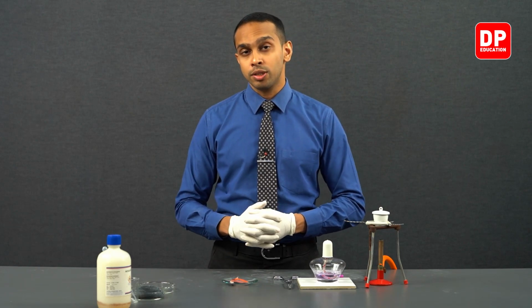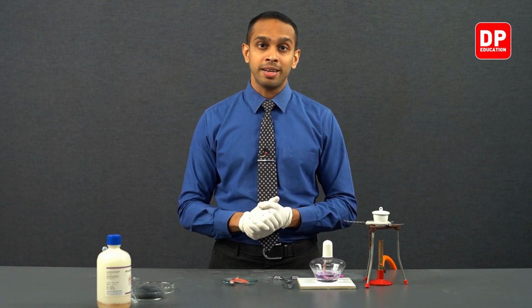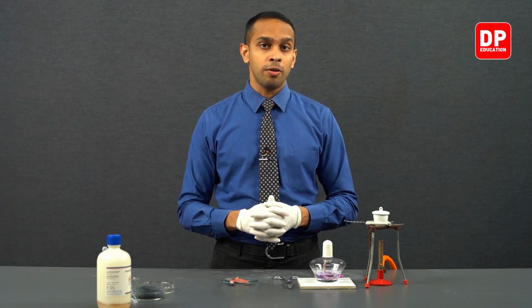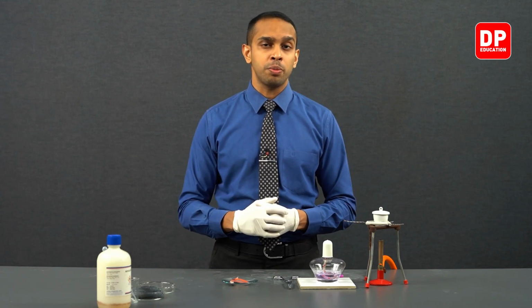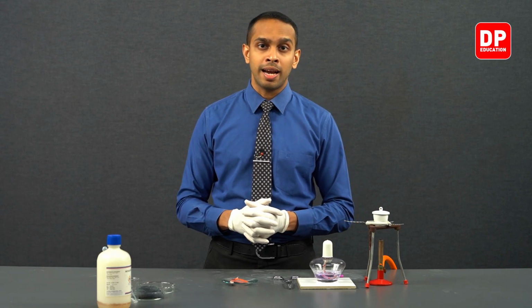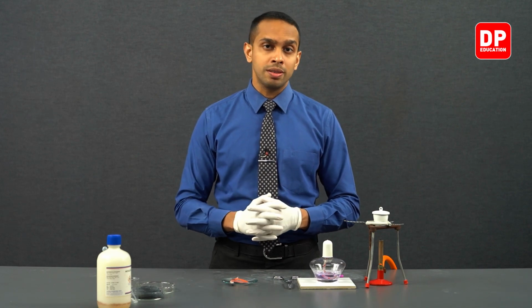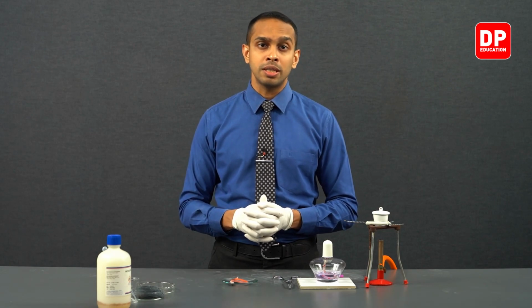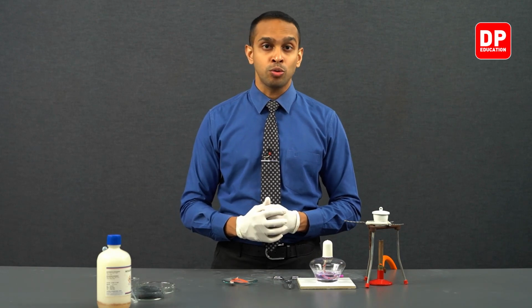Now students, as I mentioned earlier, we are trying to show that the atmospheric air contains nitrogen. Around 78% of the atmospheric air is actually nitrogen. Around 21% will be oxygen, and there's going to be another 1% of other gases, inert gases, and carbon dioxide. So in this experiment, we are going to show that nitrogen is present in the atmosphere by taking magnesium, which is a group 2 element.